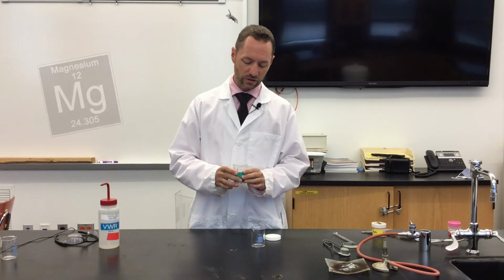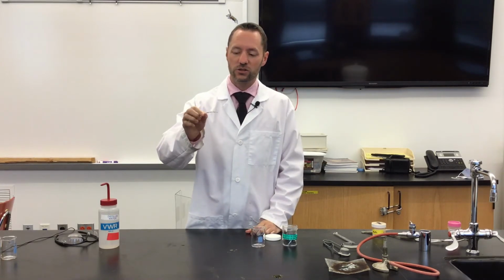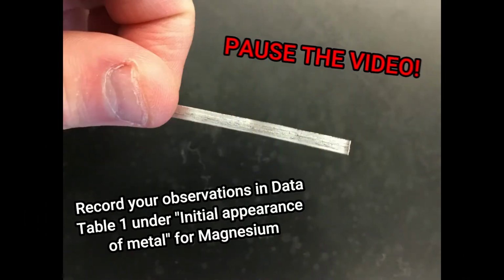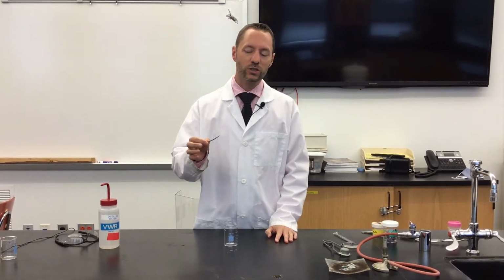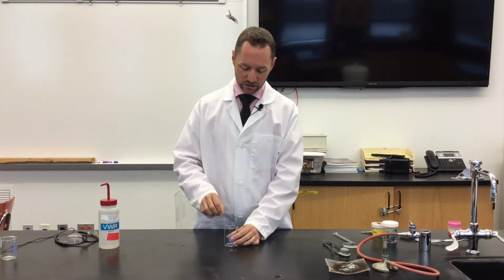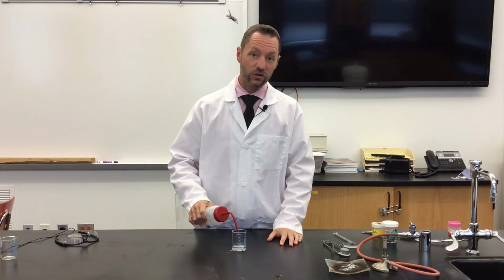Our magnesium is in the form of this flexible ribbon. So let's start out by recording some observations of this material. Now that we've recorded some observations of this material, let's test its reactivity with water. I'm going to take this piece of magnesium ribbon, put it into my beaker, and then add enough water to cover the surface.